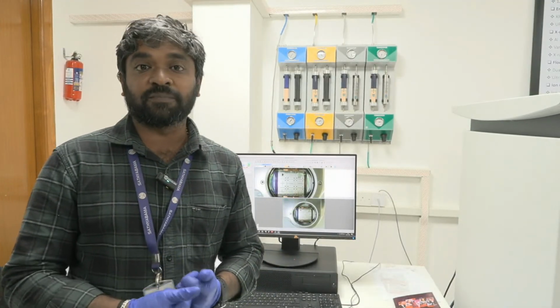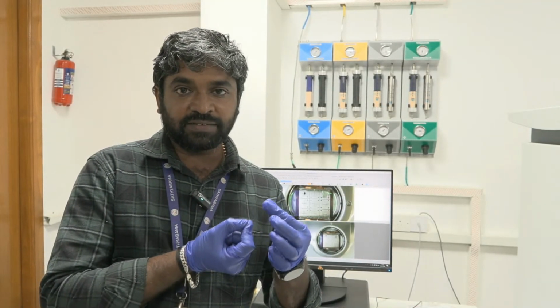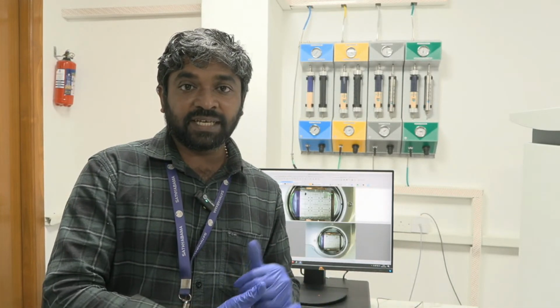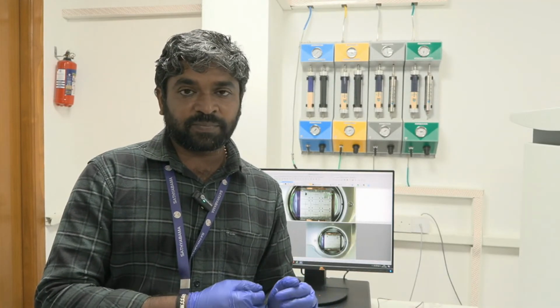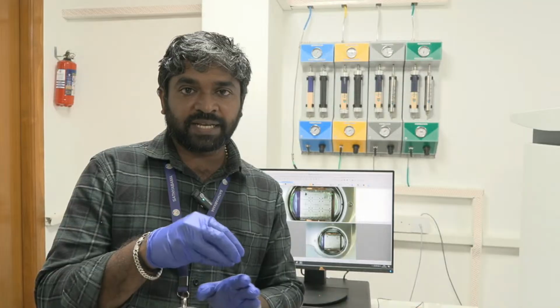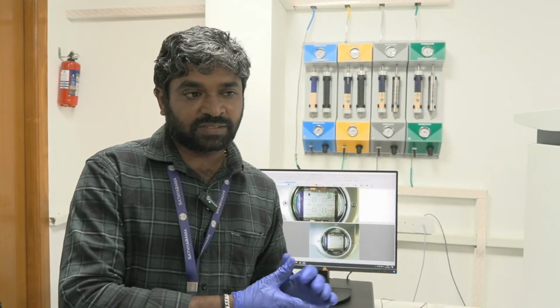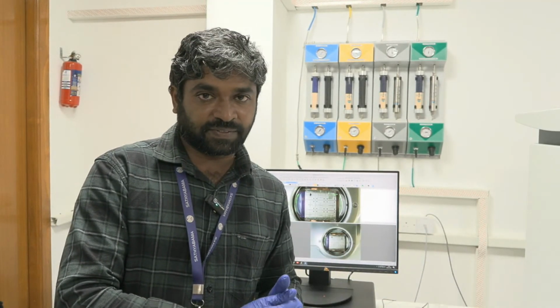So here we have different sample holders for different sample types. For example, if you have powder samples, we have the powder sample holder. If you have any thin film samples or bulk samples, we have a different sample holder. And if you have fiber kind of samples, we have the fiber sample holder. And if you want to work with air sensitive or environmentally sensitive material, or any battery kind of things, we have a separate vacuum module. So you can mount your samples in the glove box itself. Without breaking the vacuum, you can transfer your module into the system and perform the XPS. These kinds of advantages are available in these features.